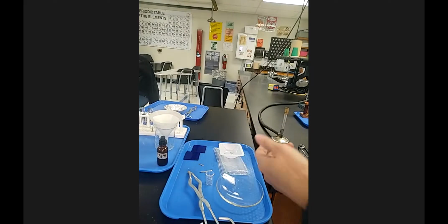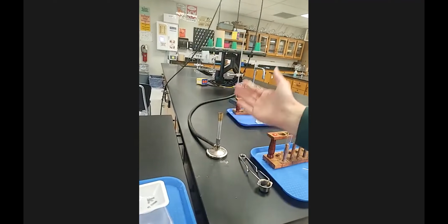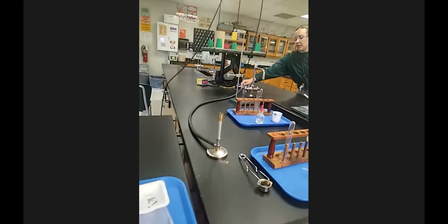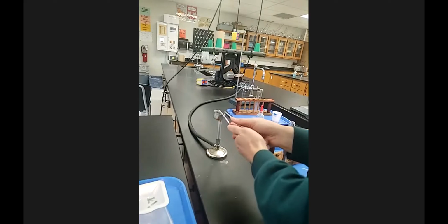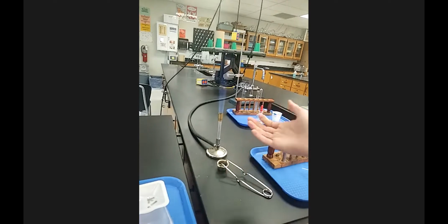This is also station 8. So station 8 says observe a Bunsen burner. So here's before, I'm going to turn the fuel line on. So I'm going to add methane gas. You can hear it maybe, like a slight rush. And me lighting it, adding a little bit of activation energy. So this is methane gas burning in the air. Here is the during. If I turn off the Bunsen burner, cut off the supply line, that'd be the after.